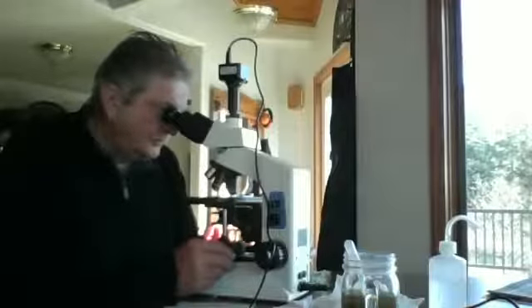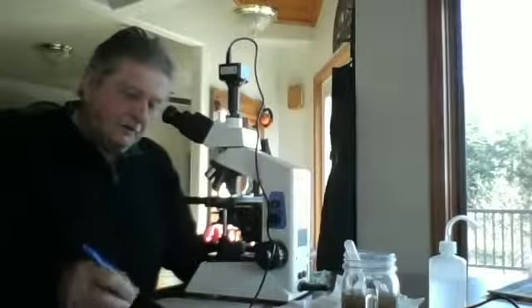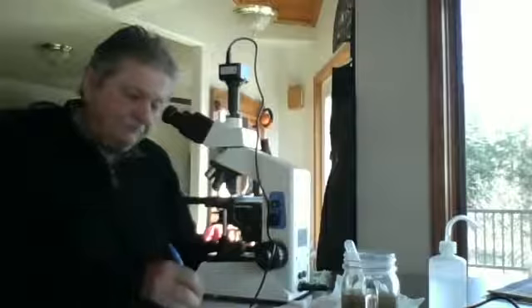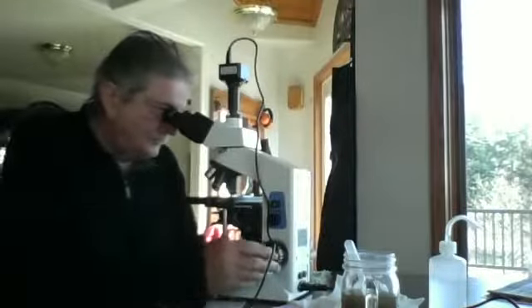See anything else in there? It'd be interesting to get more experience with looking at compost tea, which is my principal review, but in field of view 4, reading 4, 1 flagellate.